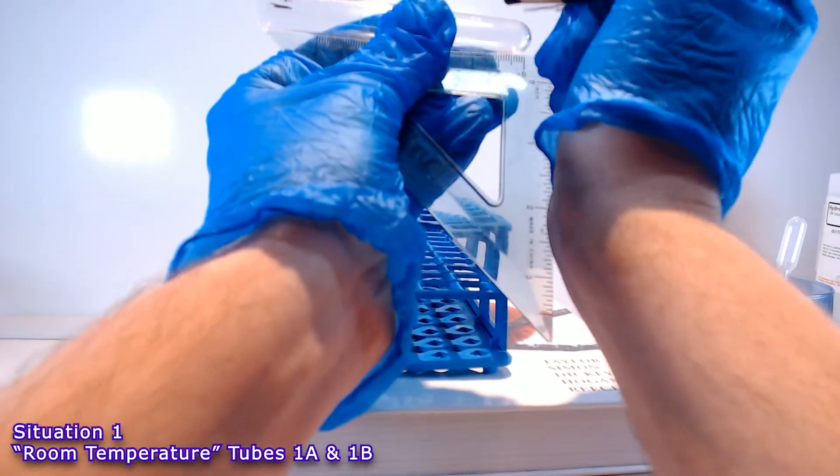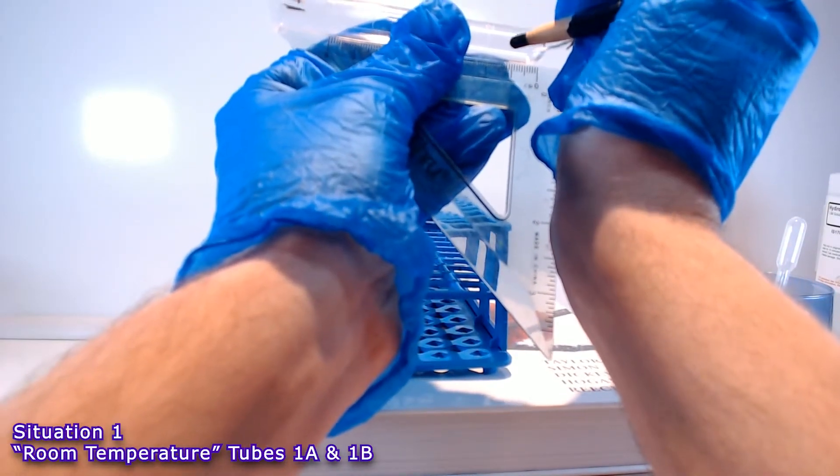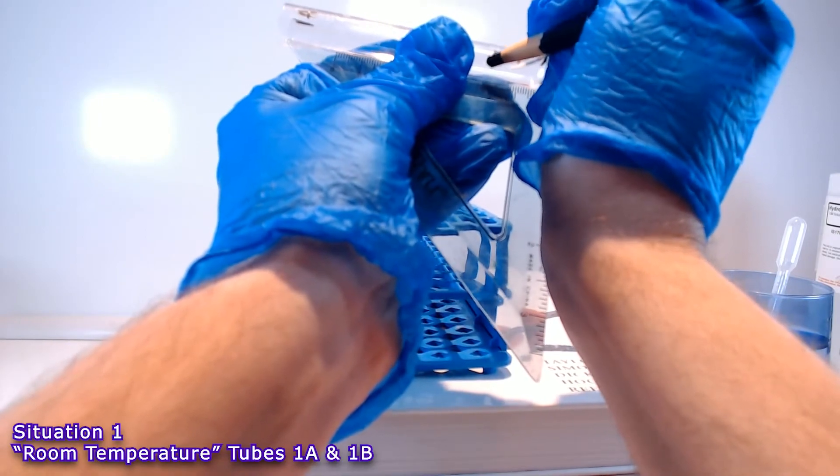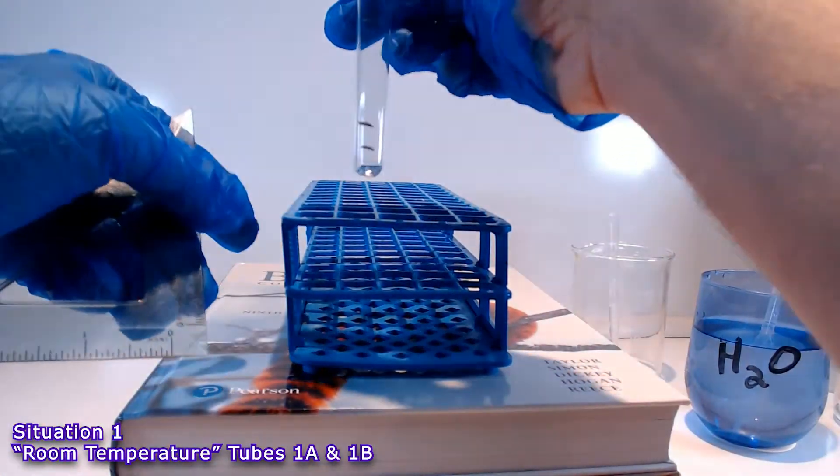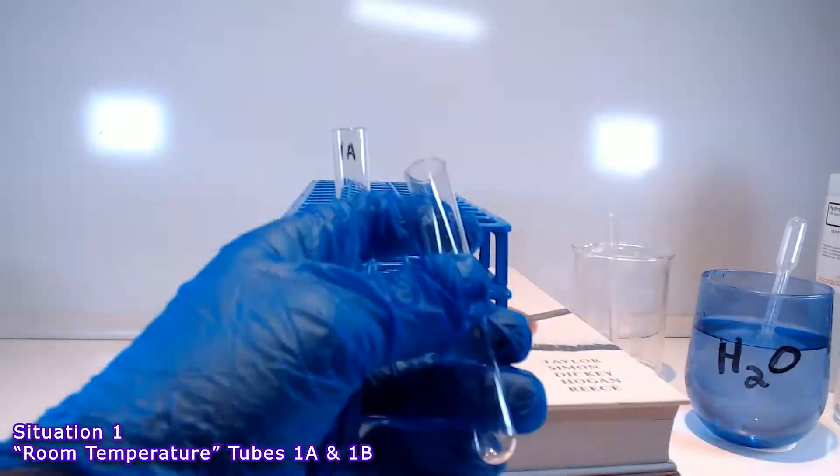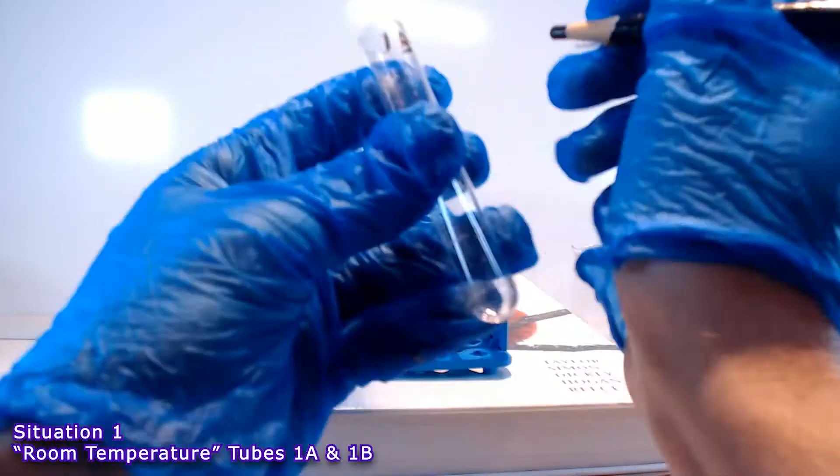Here's my mark one centimeter from the bottom, two centimeters from the bottom. Ready to go. And then I repeat the procedure with tube 1B.